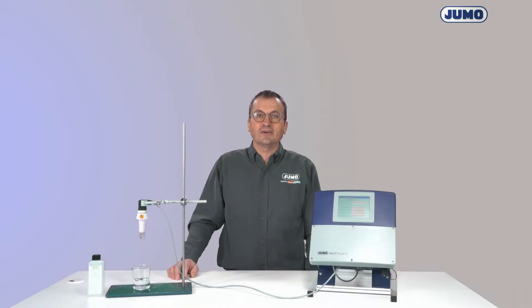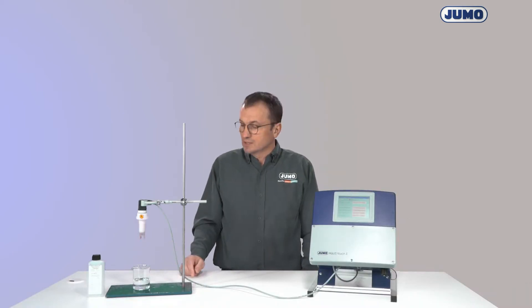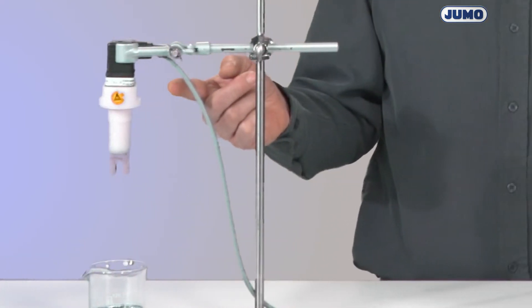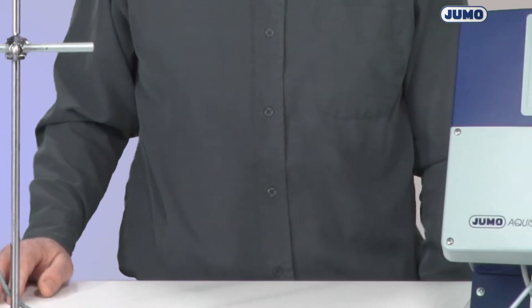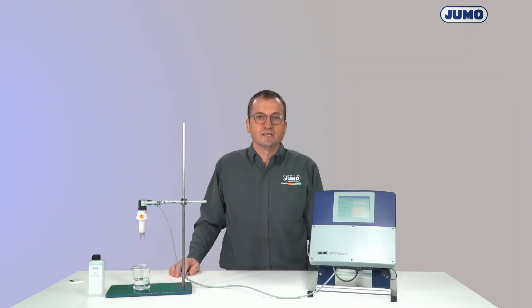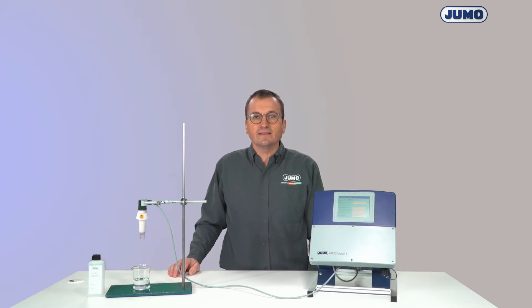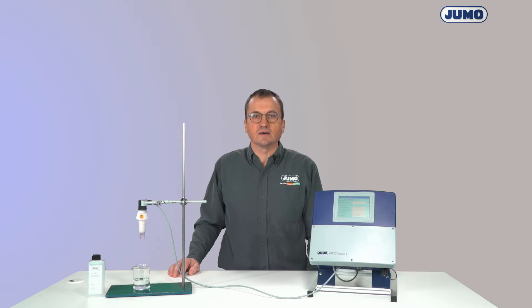Here I have already set up a measuring chain with a conductive measuring cell. The measuring cell is connected to the transmitter and the transmitter measures the conductance, which is the reciprocal of the ohmic resistance. At the transmitter, I have entered the cell constant of the cell.